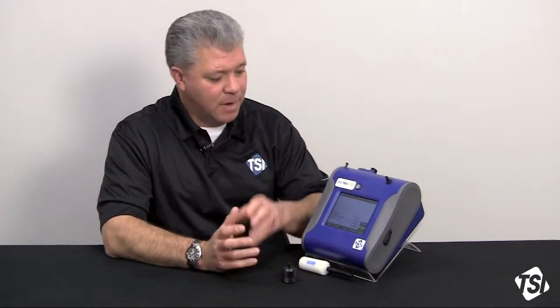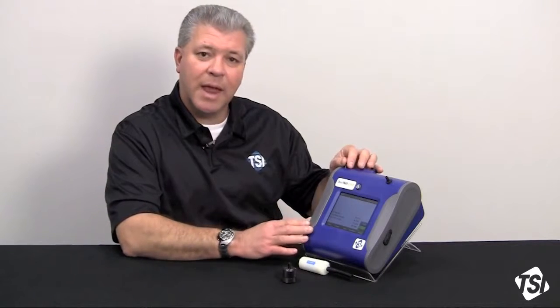We have two models. Specifically, what we're going to do today is talk about and go through a size correction factor calibration, also known as a standard calibration for the DustTrak DRX. This calibration utilizing a size correction factor is unique to the DustTrak DRX series of instruments — it is not possible to do this on a single channel photometer. We'll be looking at a change in the ambient aerosol size distribution relative to the size distribution of Arizona road dust, or A1 test dust, that the DustTrak is calibrated to.